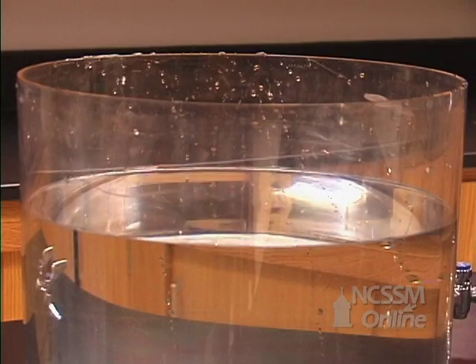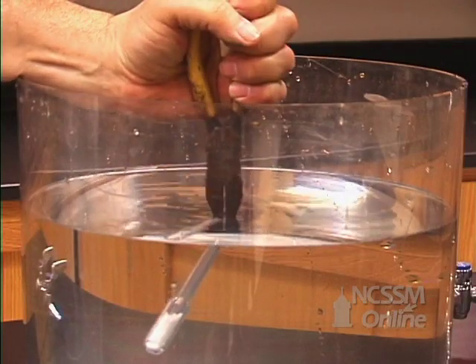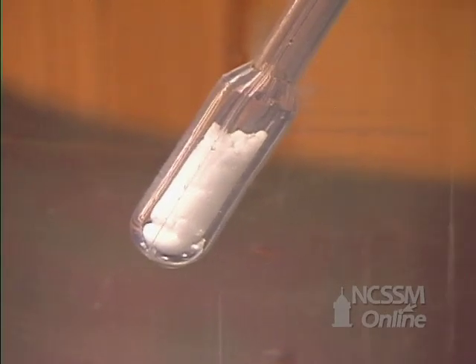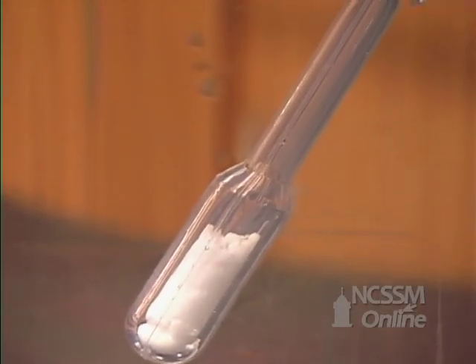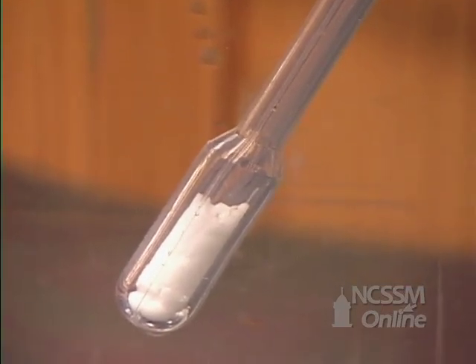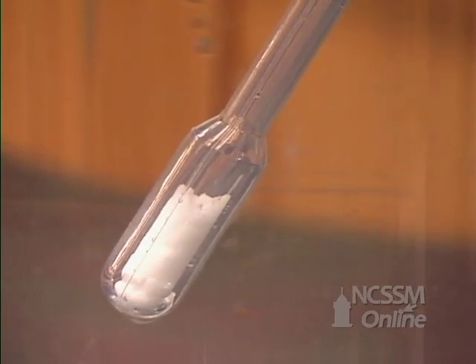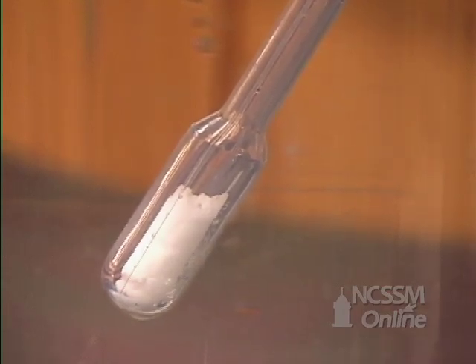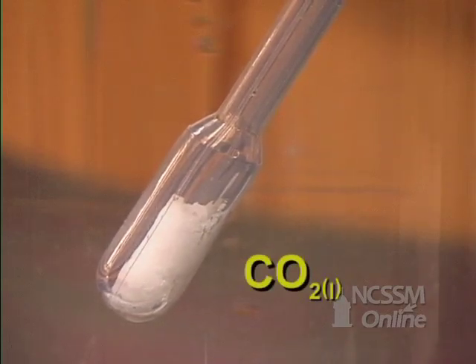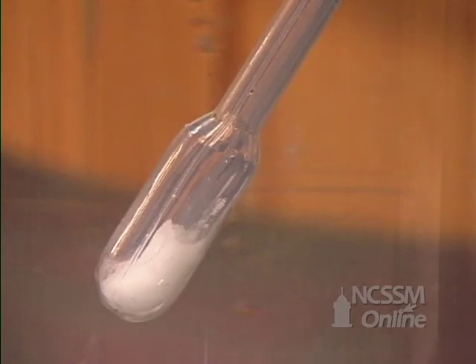We're going to pinch off the top of the pipette with a pair of pliers and put it into a warm water bath. As the CO2 continues to sublime, the pressure inside the pipette will increase. Eventually, the pressure goes above the triple point and the CO2 liquefies. We'll see the liquid carbon dioxide in the pipette.